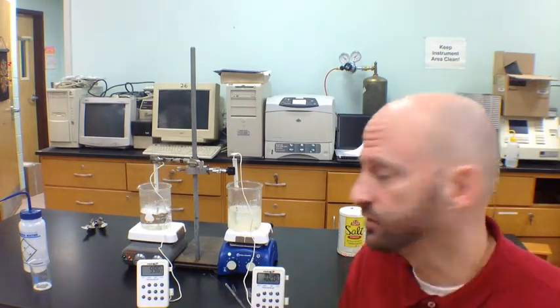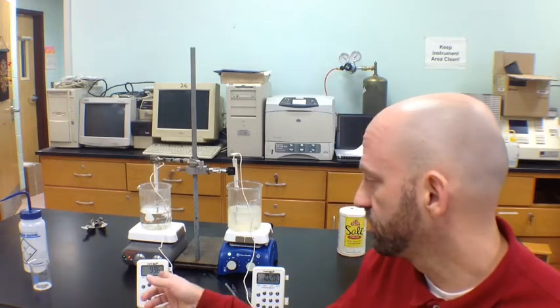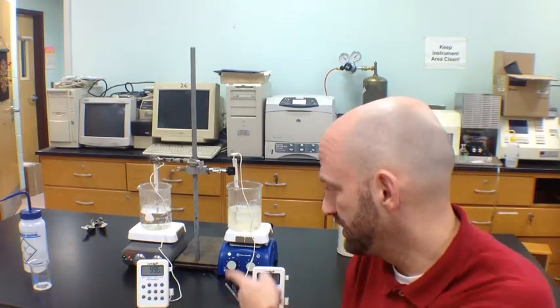Hey everybody, welcome back to our short little demonstration here. Now both of the beakers are boiling and they've both been boiling for a couple of minutes, and their temperatures have somewhat equilibrated. But let's see if we notice any differences. On the left we have the beaker that was just pure water, and of course we know that the boiling point should be right at 100 degrees Celsius. If we look at the thermometer here, we're seeing about 99.6 degrees Celsius. So pretty close to 100 degrees.